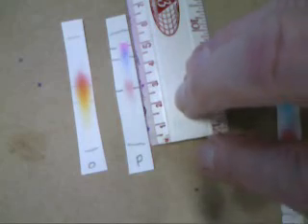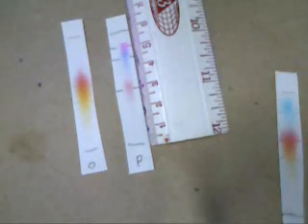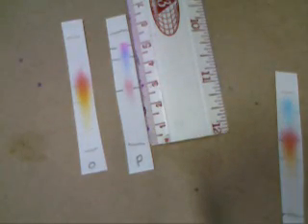For our purple dot, we again seem to be getting 3 colors. Again, a light red that's down around 3, and a blue at about 4.5, and sort of a light purplish at 5 for the sample. And those are the ones that are making our purple color.